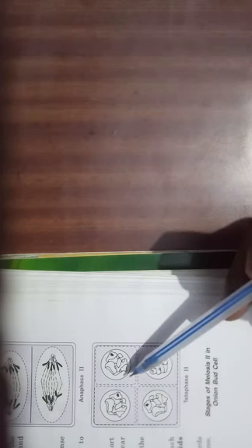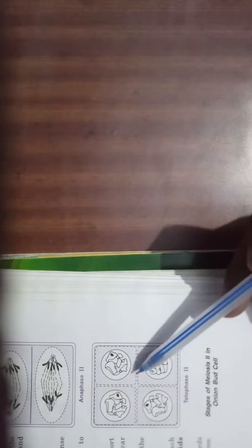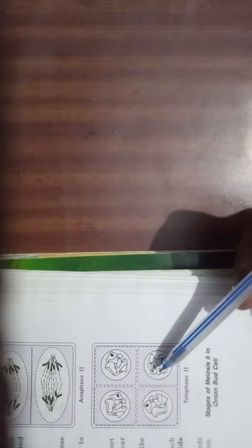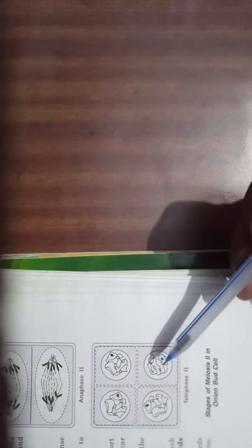Some precautions to take during this experiment: floral buds should be fixed between 8 to 10 AM, and slides should be warmed gently to avoid overheating. This concludes the experiment.